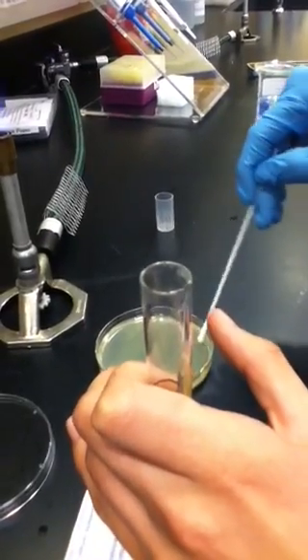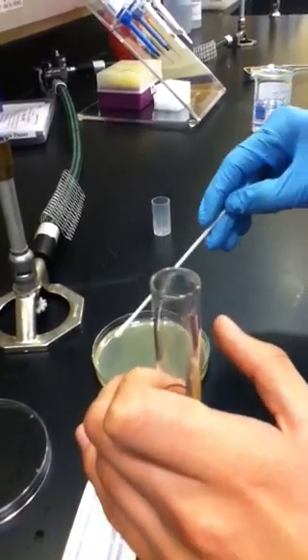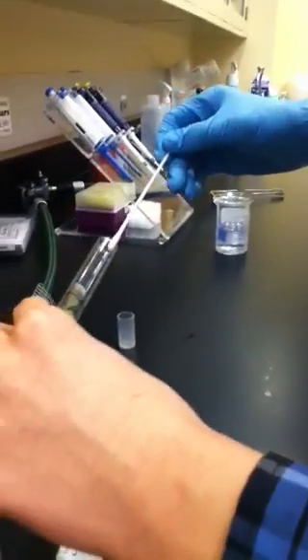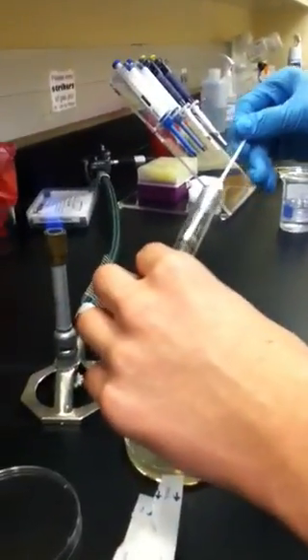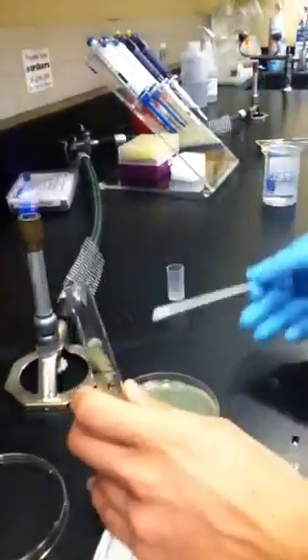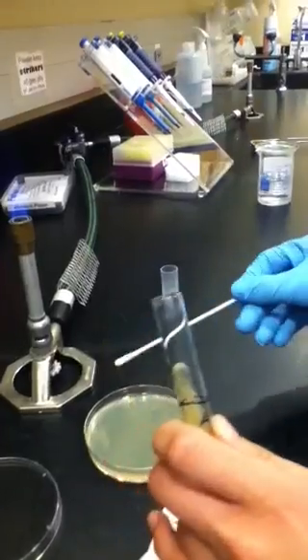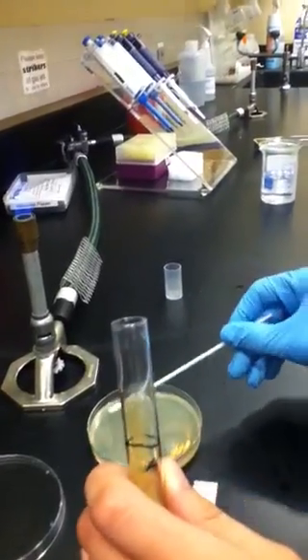I can already smell them. They don't smell good. Then I'm going to take some more bacteria just for good measure. Turn it 90 degrees and go again.